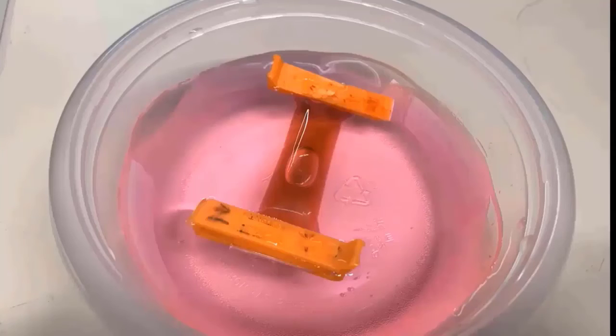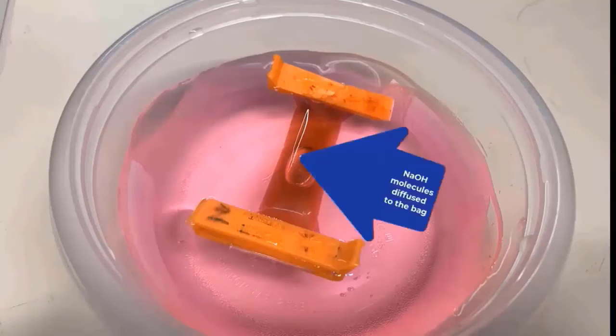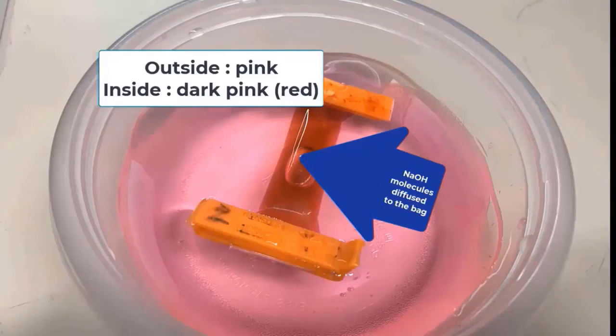At the same time, as you see here, the inside of the bag turned pink, and the molecules that diffused into the bag were NaOH molecules. That's why the inside also turned pink.